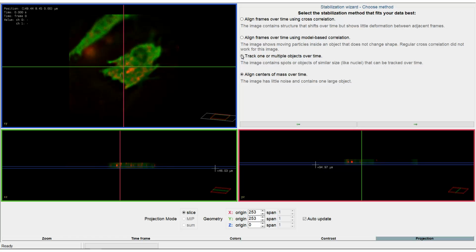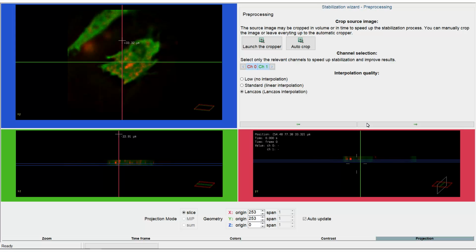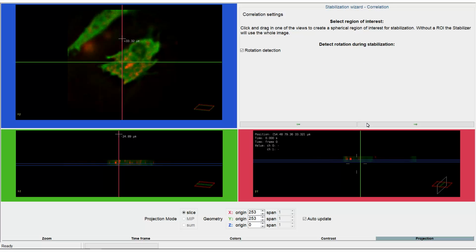We choose the cross-correlation method for now. And continue to the next step. In the pre-processing step you can now crop the images and disable channels that are not relevant. You can choose the interpolation quality as well. Next you can set a region of interest for the stabilization, by clicking and dragging on the image to select a spherical region. You can also enable or disable rotation detection.